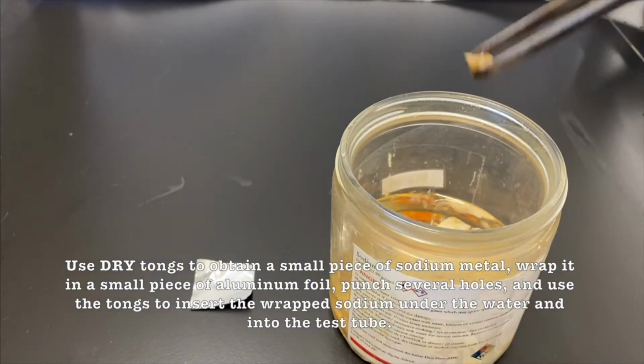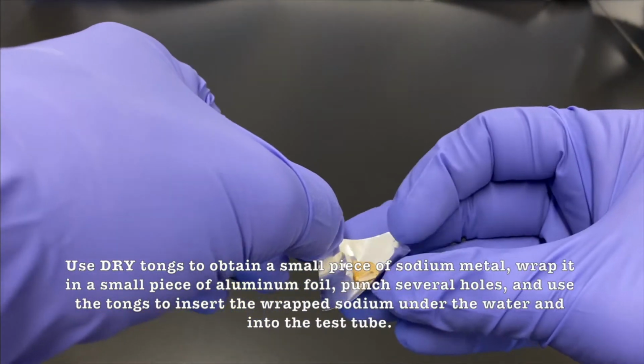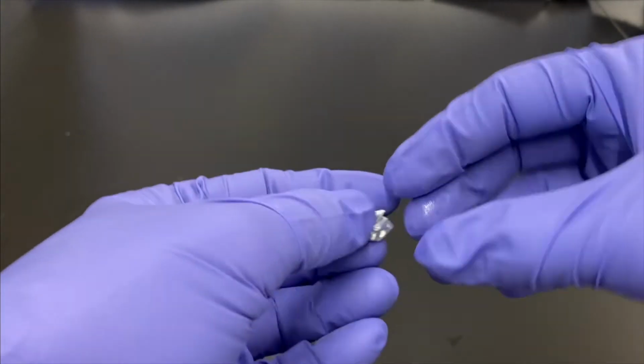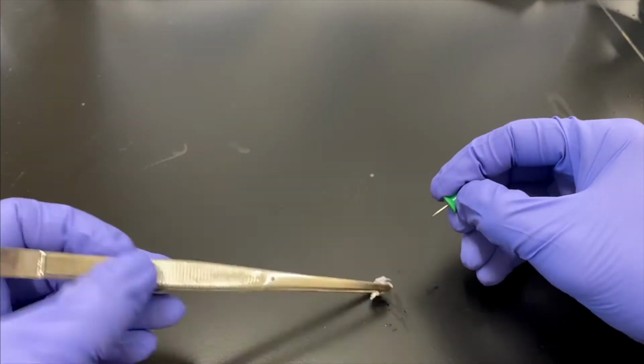So we'll get a real small piece. We're going to cover it with tin foil. All right. And it's like we're at Chipotle, right? Wrap it up. Yeah, if you didn't do this, you would just get a very giant flame on top of your water, which is a little dangerous. So we're going to try to minimize that.